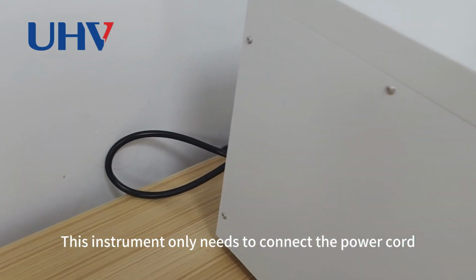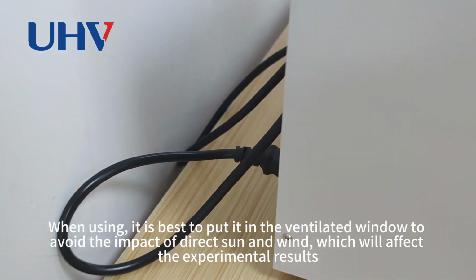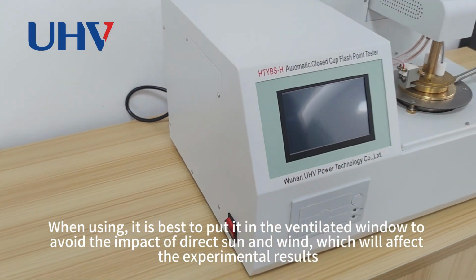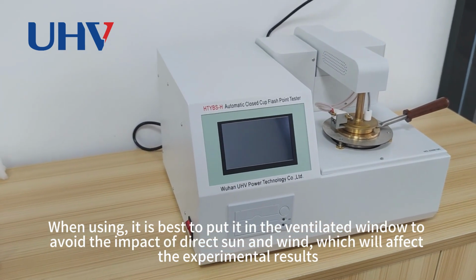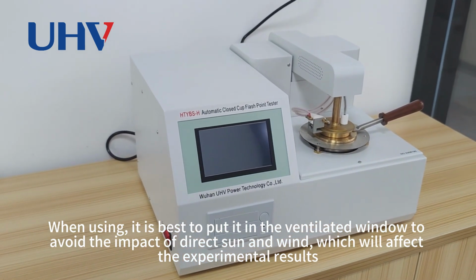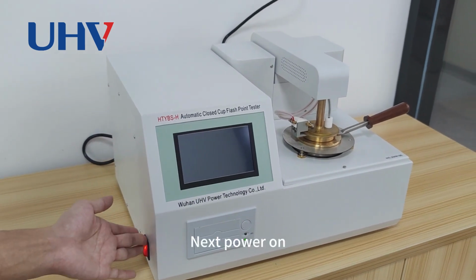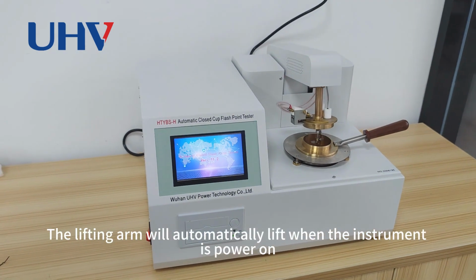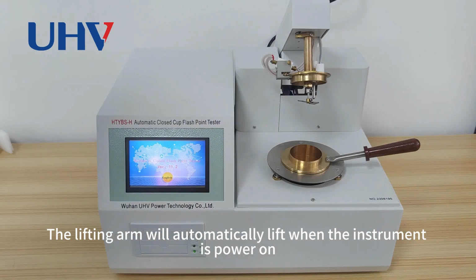This instrument only needs to connect the power cord. When using, it is best to put it in a ventilated window to avoid the impact of direct sun and wind, which will affect the experimental results. Next, power on. The lifting arm will automatically lift when the instrument is powered on.